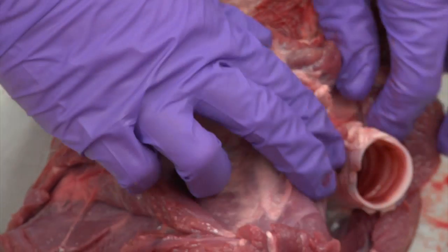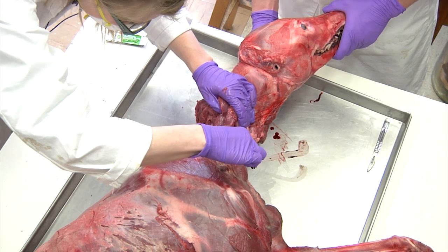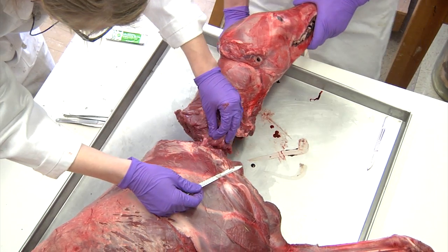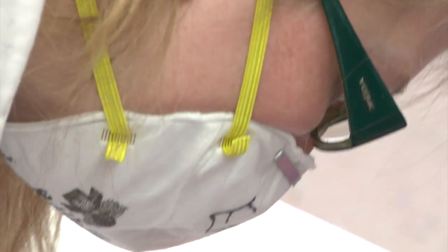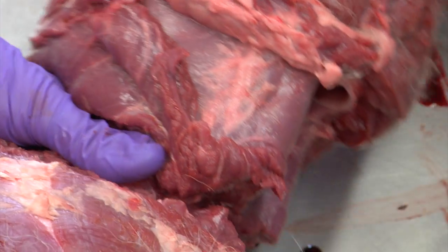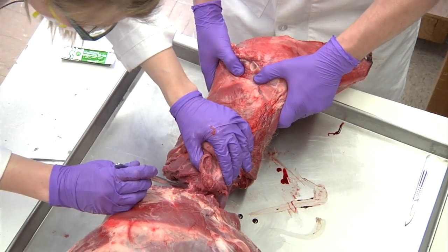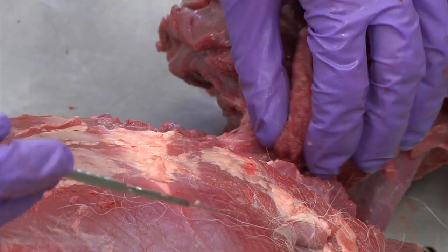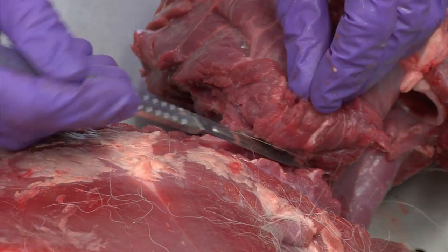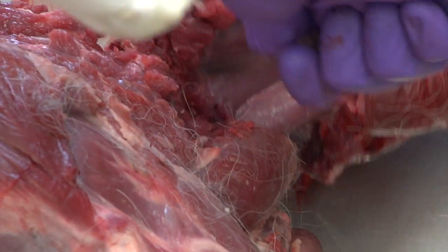It just looks like a pipe — it's like a whistle. Not that I want to put my mouth on it and blow across it. Now I'm just hitting the bone. I would ideally like to cut between two of the vertebrae, but it might be kind of hard to find where they start and end. I can feel the dorsal spine of one of them — that's the top of the vertebrae. Can you move his head maybe side to side? Oh, there we go. So when James did that, I could see where two of the vertebrae were occluding together. So I can cut around the cartilage. It's frozen — you can hear it. It's like cutting through ice.